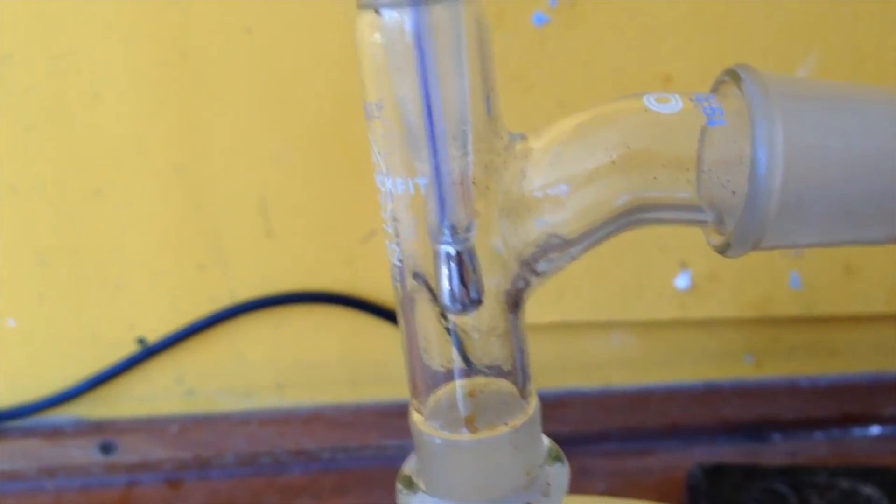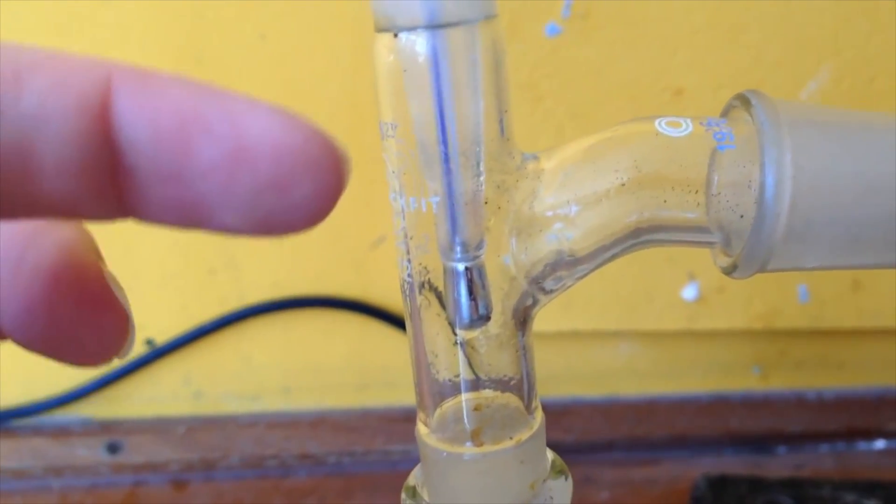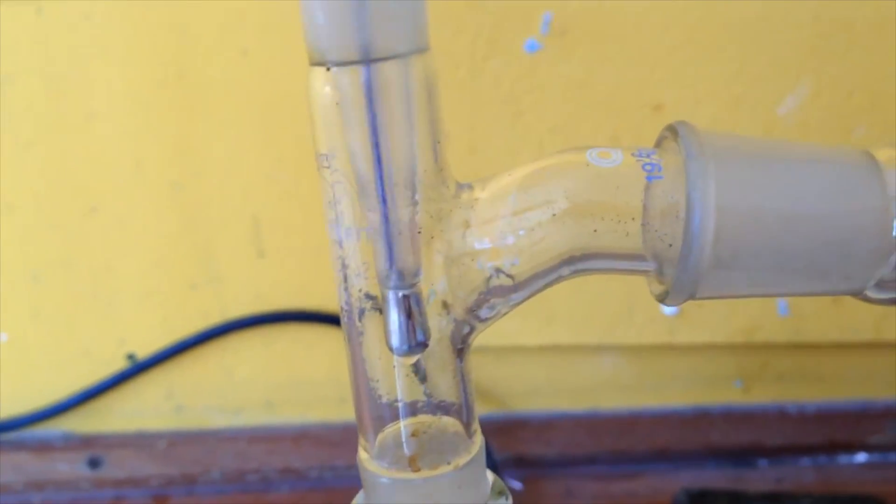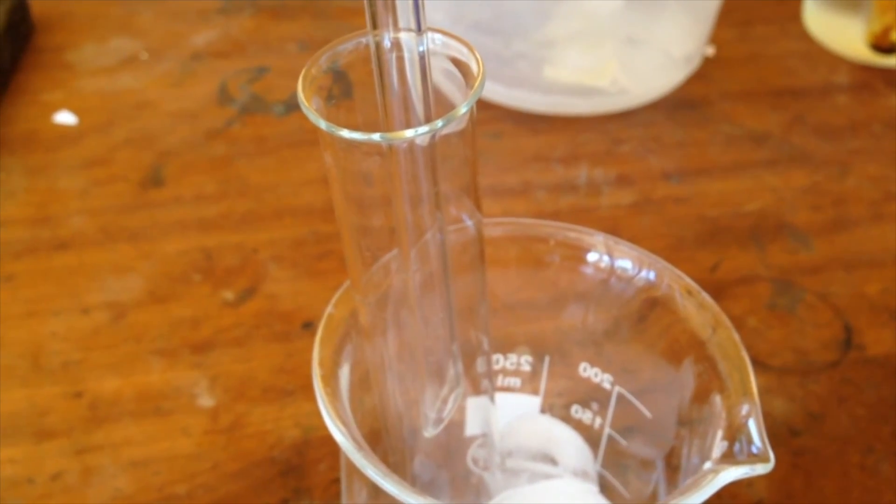So it's been about 20 minutes now and we can start to see that we've got something condensing up here. Now what we need to do is get enough so we can move along the tube and then end up in our test tube.